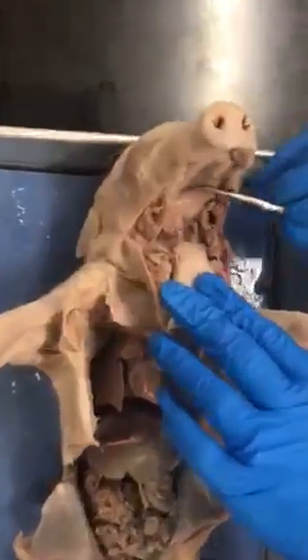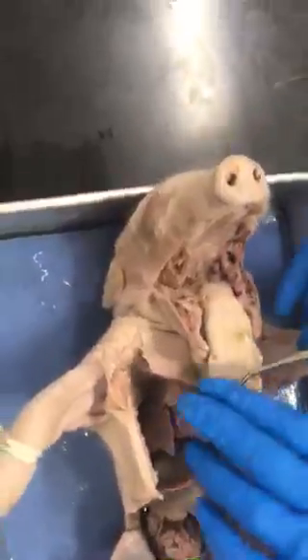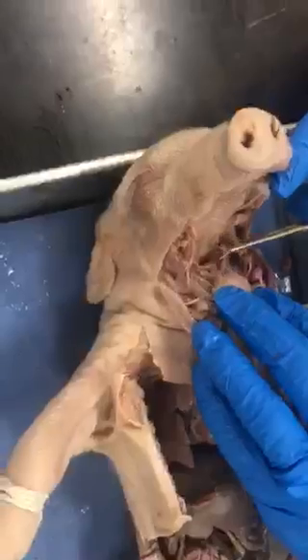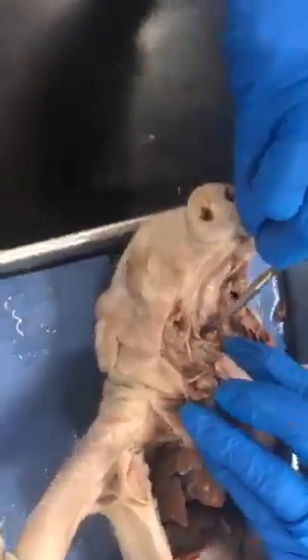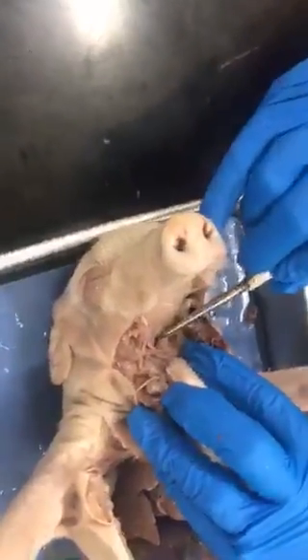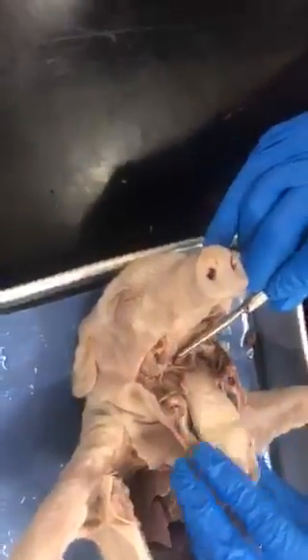Okay, so this is the hard palate, and then at the back is the soft palate, the tongue, lingual frenulum. Ooh, cut, cool. The lingual frenulum was this tissue that was holding the tongue tight to the bottom of the mouth like that. The epiglottis is this flap that looks like an upside down spoon. And the nasopharynx is the space up above, which is below because the pig is upside down, at the back of the snout. So if it's behind the epiglottis, it has to be nasopharynx.